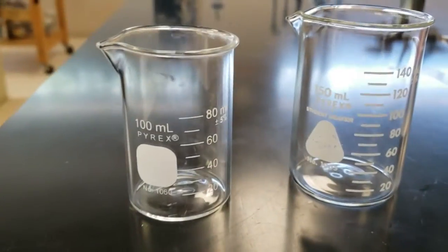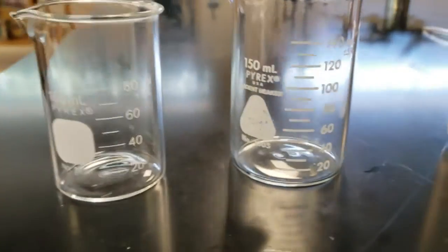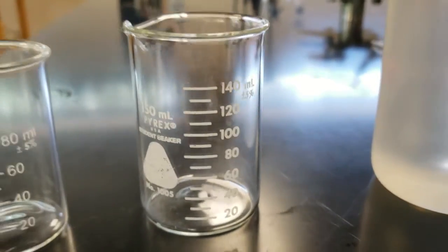Here is our list of equipment that we need. This is a 100-milliliter beaker, a 150-milliliter beaker, and they're clean and dry.